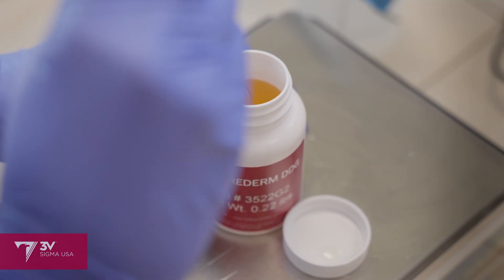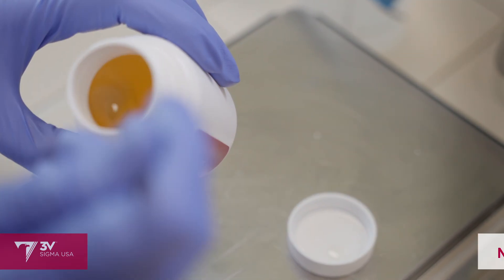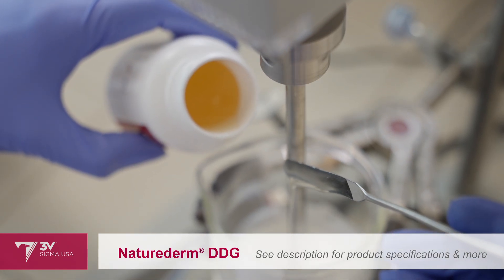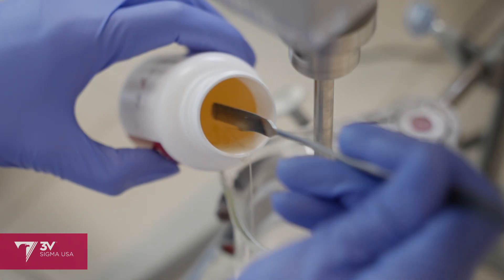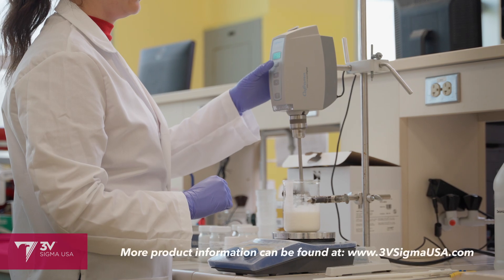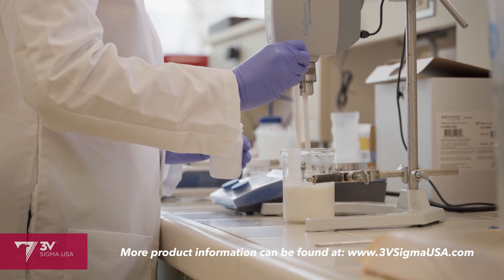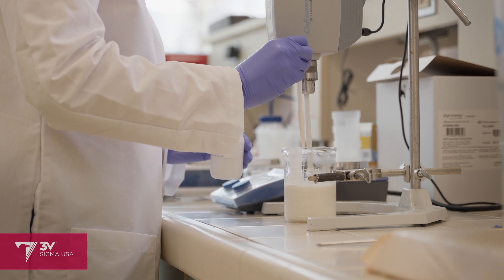Before turning off the heat, the last material I'm adding is Nature Derm DDG. This is a biodegradable oil-soluble film former, which promotes water resistance. Once we've cooled the batch, it's finally time to add the zinc oxide and titanium dioxide dispersions, followed by a naturally derived preservative blend.